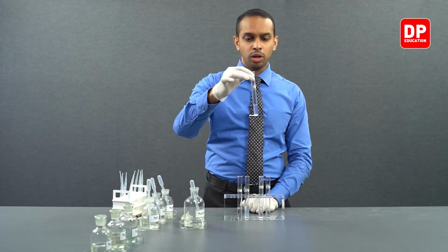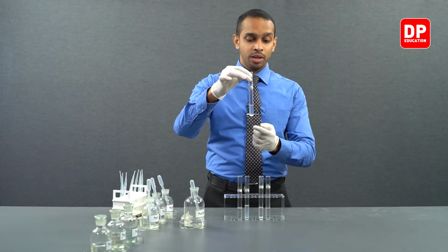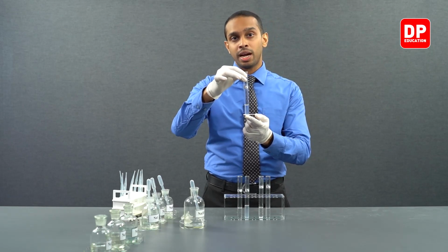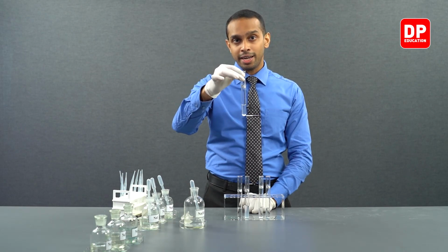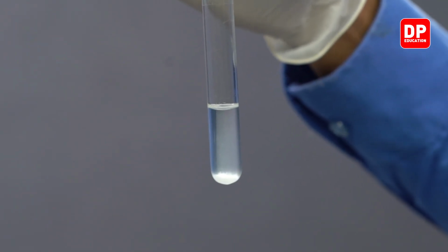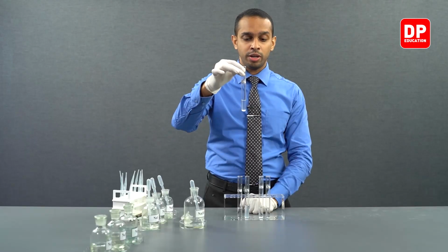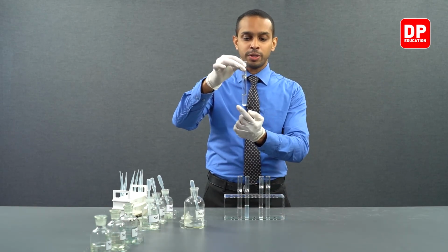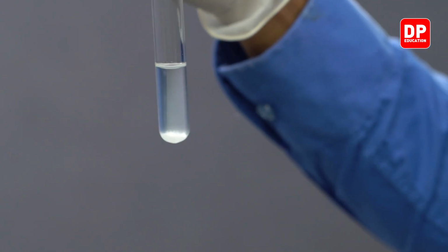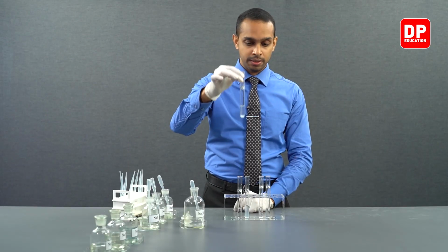Then we took a small amount of calcium 2 plus and added sodium hydroxide to this. You can see calcium 2 plus, when reacted with hydroxide ions, forms a calcium hydroxide precipitate. Calcium hydroxide is sparingly soluble in water. That means a small amount of calcium hydroxide actually dissolved in water. The remainder of the precipitate can be observed at the bottom of the test tube. This is a white precipitate.